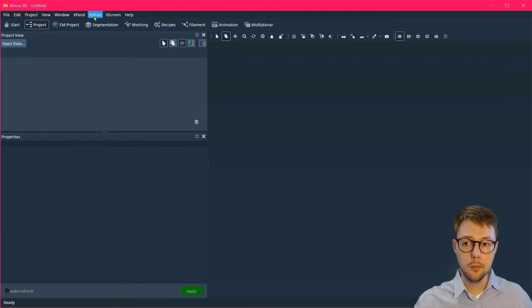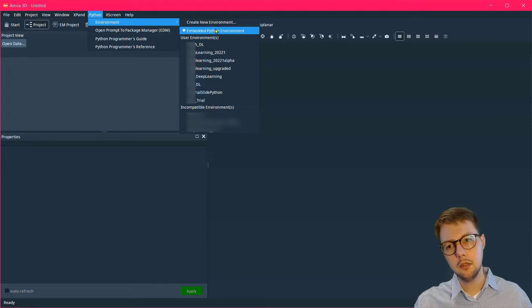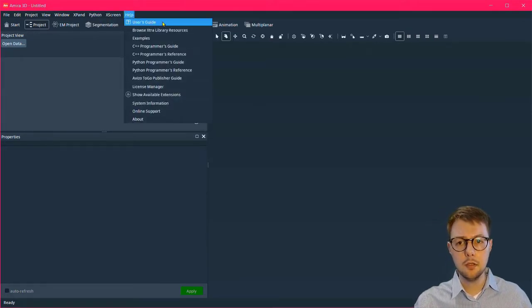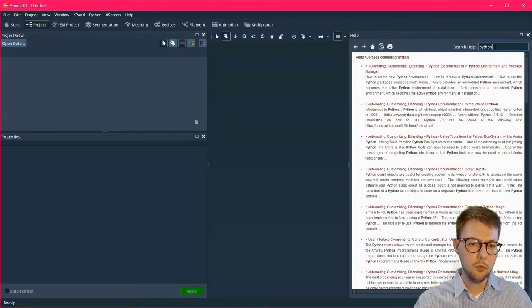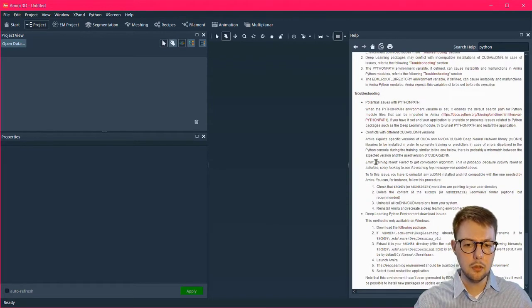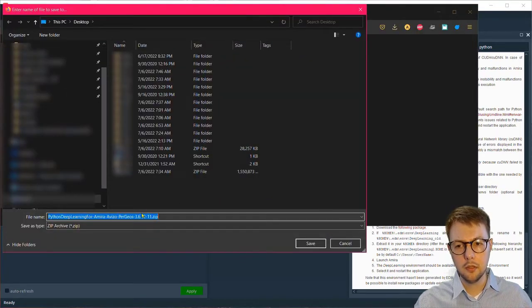Using deep learning within Amira, Avizo, and PerGeos typically requires access to the internet in order to install a new Python environment. If you don't have access to the internet on your computer that has the software installed, within the help documentation, you can search for Python, the top hit, click on that, and navigate to the very bottom under the header troubleshooting. Click this download link, and this will install a .zip file in a directory of your choosing.